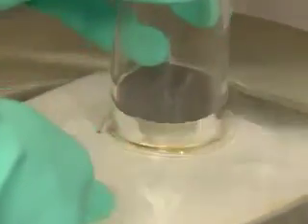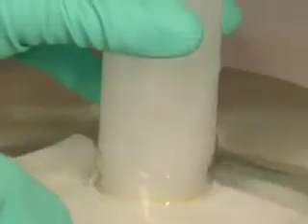All four compounds are gases. They're also very soluble in water. Here's water swallowing a jar of hydrogen chloride.